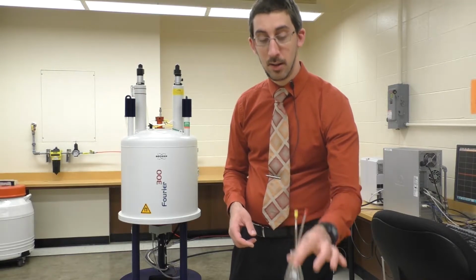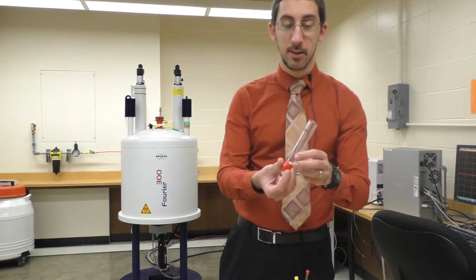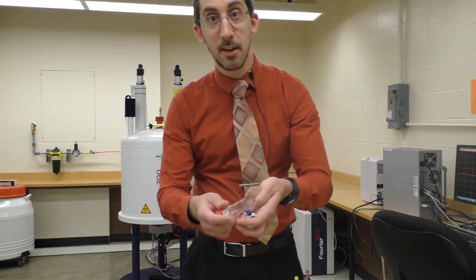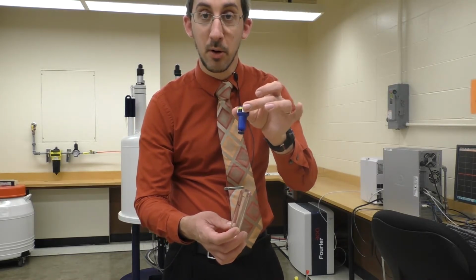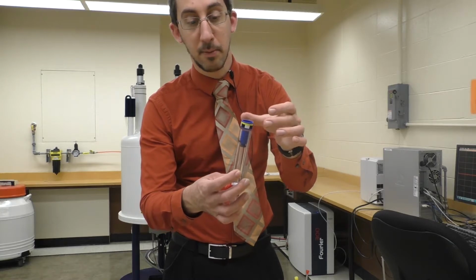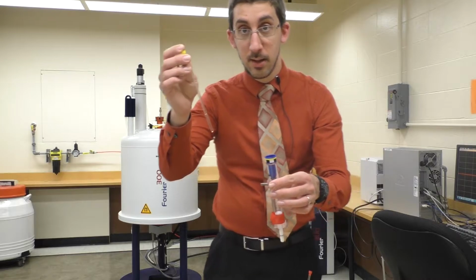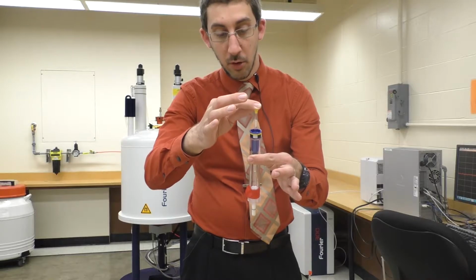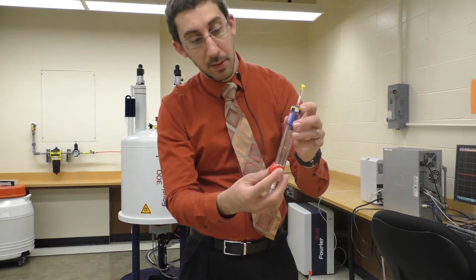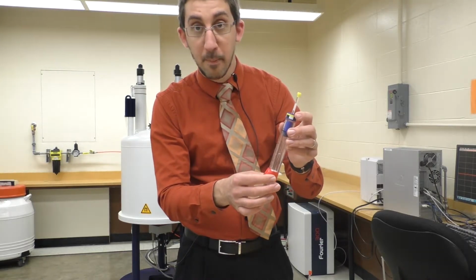So what we do first is we've got our NMR tubes right here, and we have a little depth gauge, that's this piece right here, and a blue spinner shown right here. Now this blue spinner is where your NMR sample is going to sit, so we'll place that on top of the depth gauge. Then we'll take our sample, let's do the liquid one here. We'll place that down through the spinner and push it all the way down so that I get the right depth for my NMR tube so that it will sit in the correct position in the magnet.